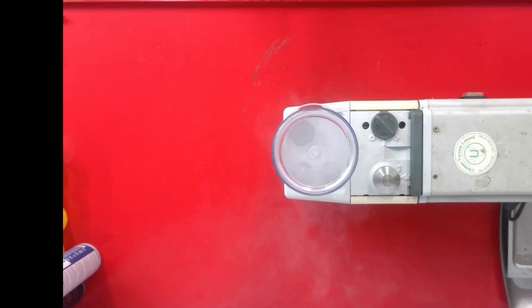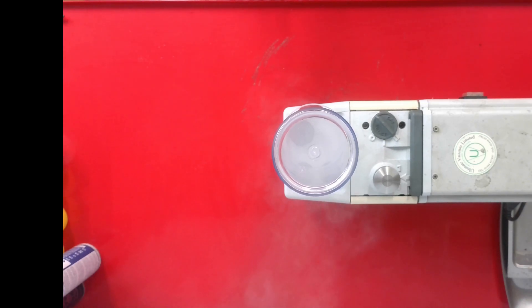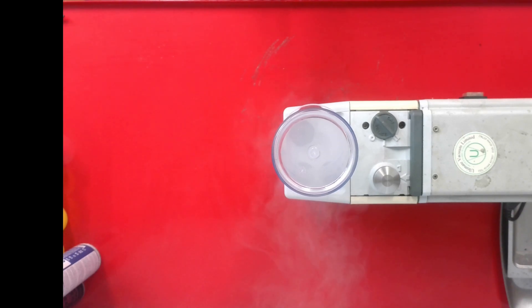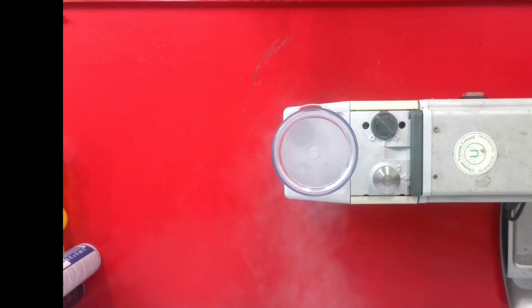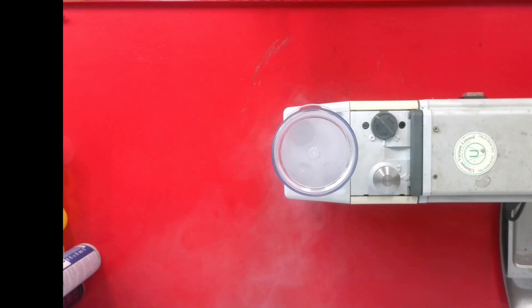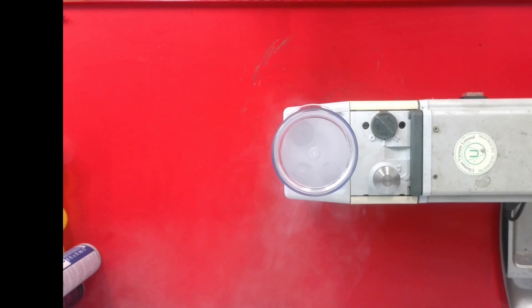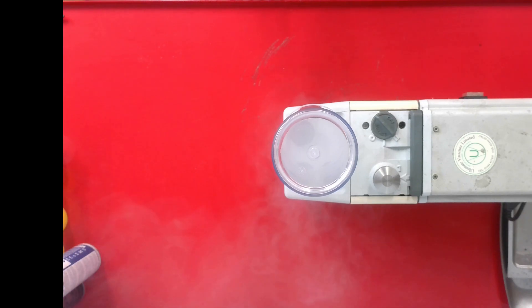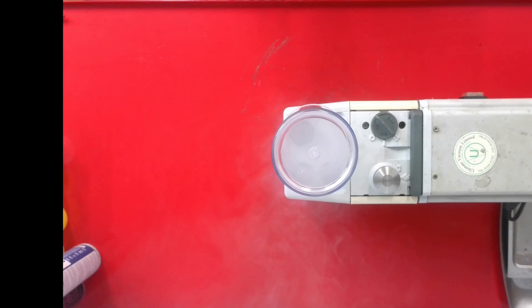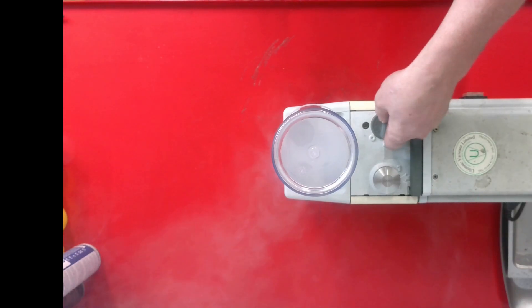That mist — some research suggests it's a carcinogen. In any case, it is nasty to have in the lab. It smells of oil and it has to be stopped. It's a normal function of any pump that it will produce that mist under those conditions.